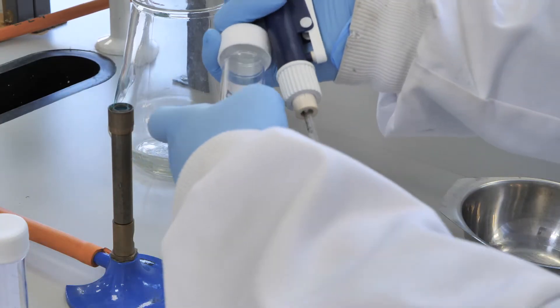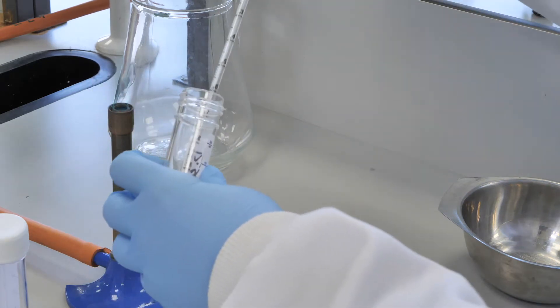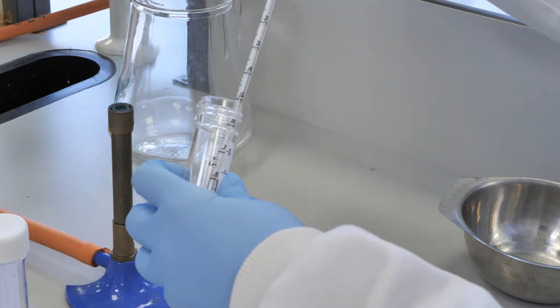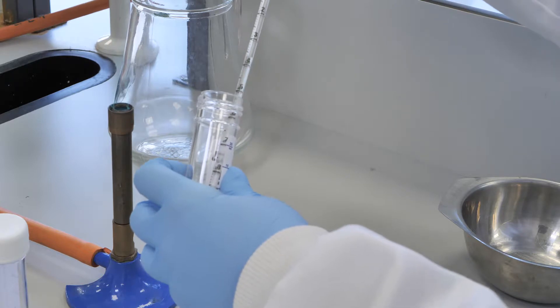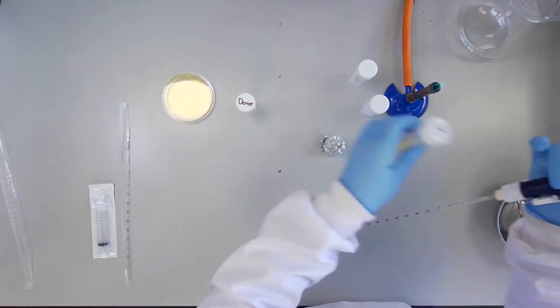Pipette one milliliter of donor and one milliliter of recipient into a clean universal container.